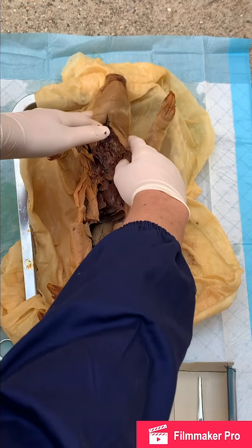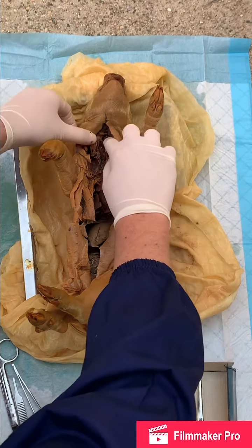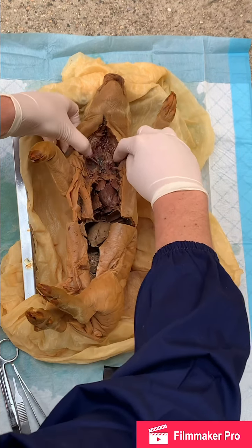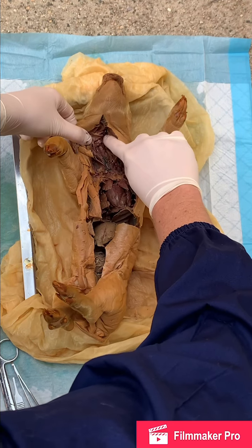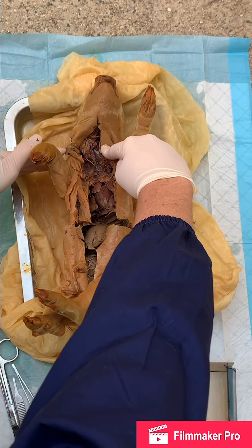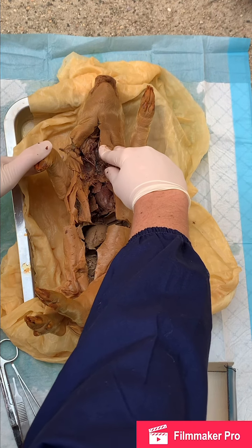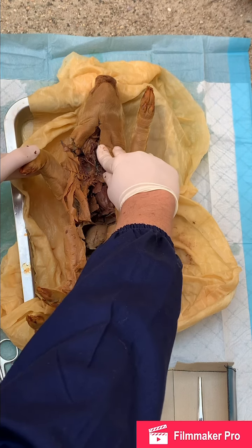Okay, so the first thing you want to look for is his larynx or his voice box. His larynx is going to come here from the pharynx up top, and down here you can see the tissue right in here. This connects the pharynx with the trachea, and it has 9 pieces of cartilage in the walls. The epiglottis is also located in here, and this is where the vocal cords are.